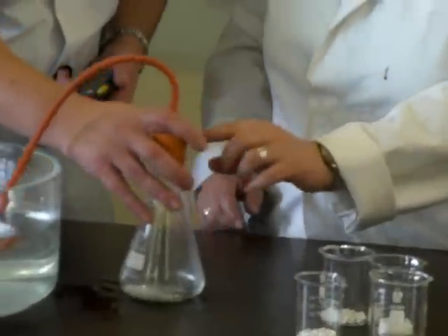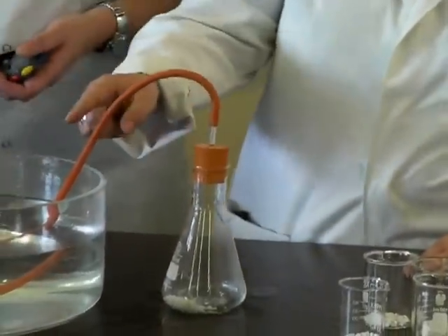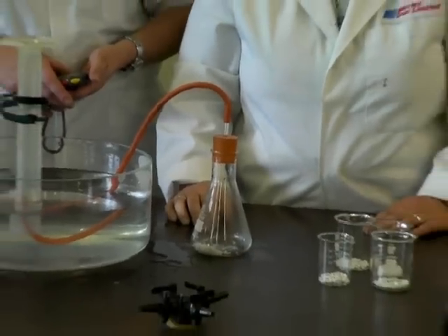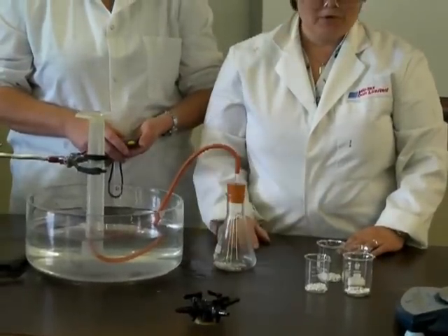We need to connect the rubber bung so the gas that's produced, which is carbon dioxide, bubbles out and is collected using a measuring cylinder. We are going to time it. Miss Simone is going to time it.